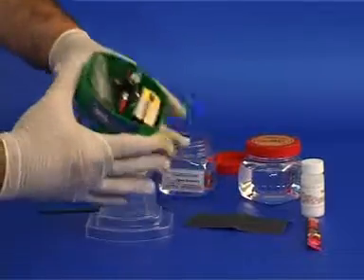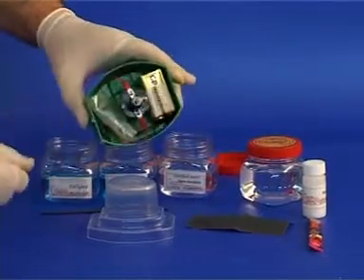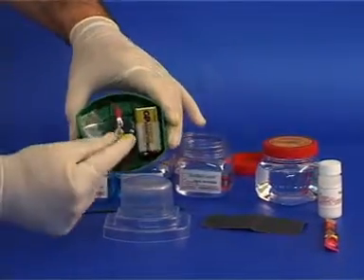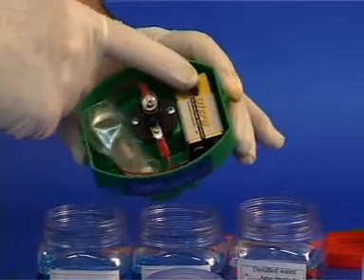Now let us examine the conductivity apparatus. We have a bulb which must be screwed in tightly to ensure that it works. There is also a spare bulb and a battery.